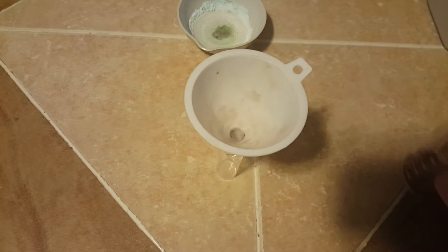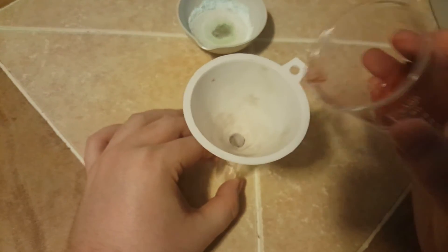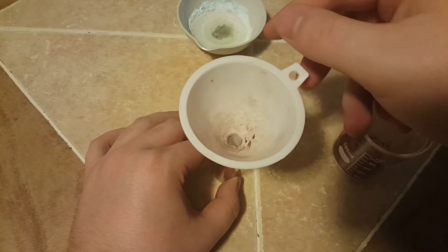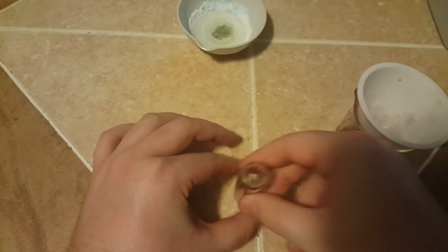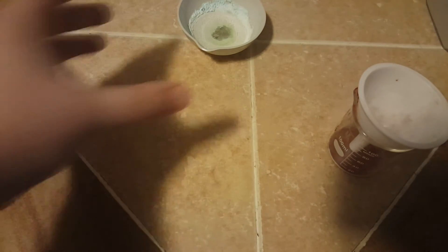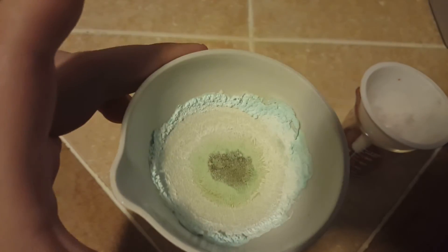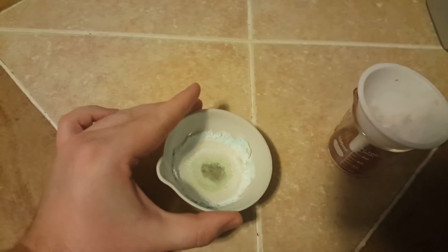It's been about a week and all the powder has had plenty of time to dry. I've put it into this beaker to make it a little bit easier to pour into our dram vial. I've also poured a little bit of our original solution into this evaporation dish. As you can see there's a lot of salt left behind from this reaction, which tells me that the reaction probably didn't go to completion — meaning that to get the most yield out of it, it will be preferable to use some sort of heat.